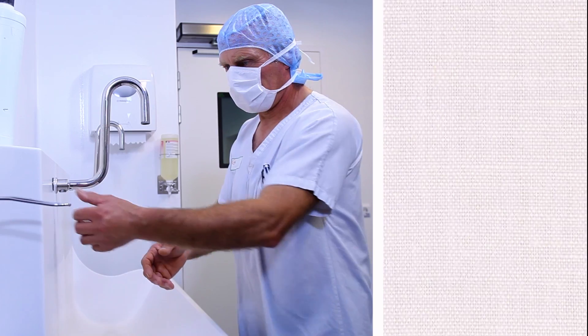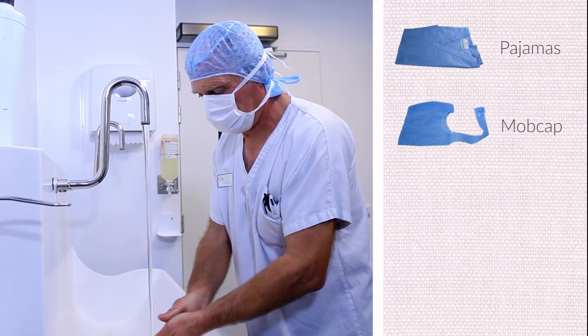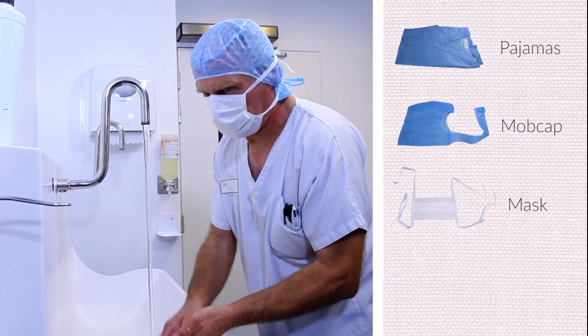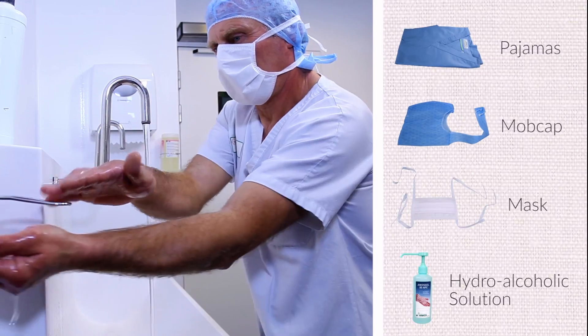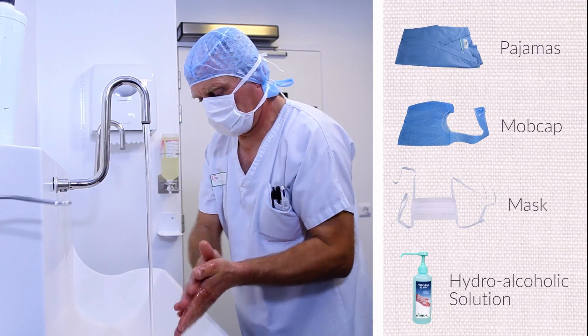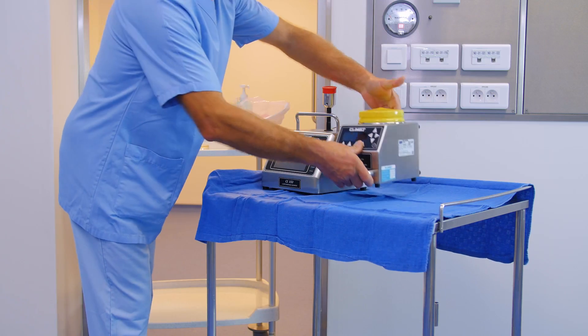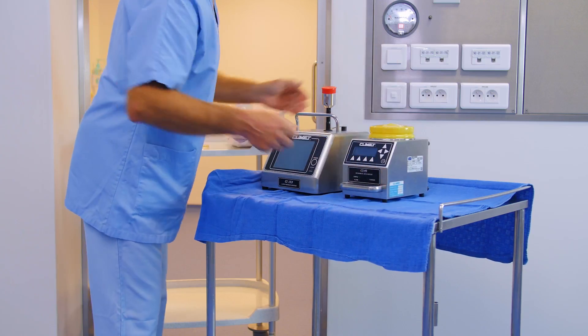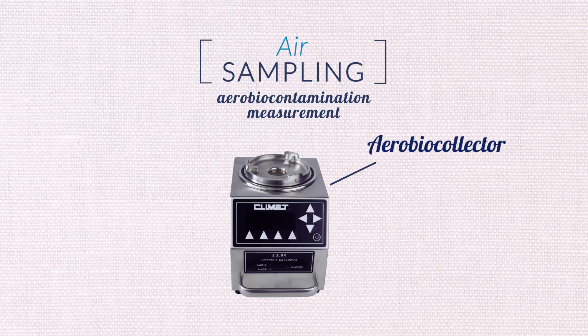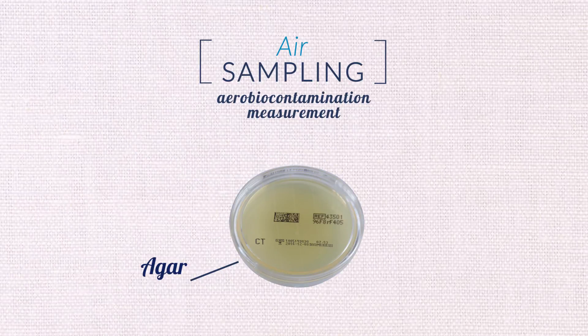The technician complies with dressing and hand hygiene regulations. For aerobio-contamination measurement sampling, we will use one aerobio collector, one nozzle, and one agar.